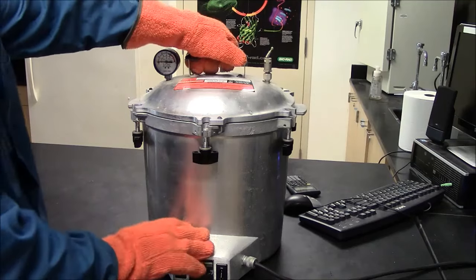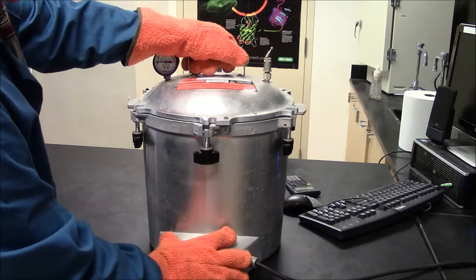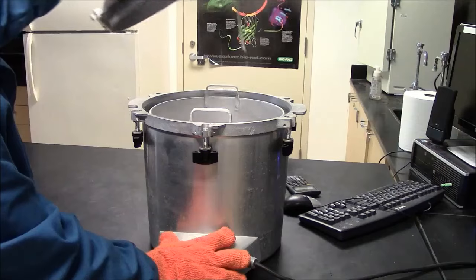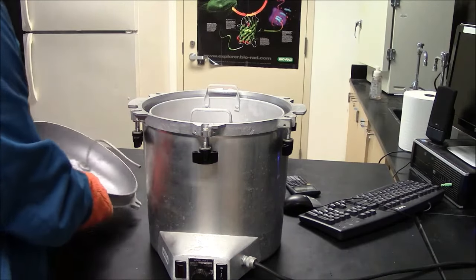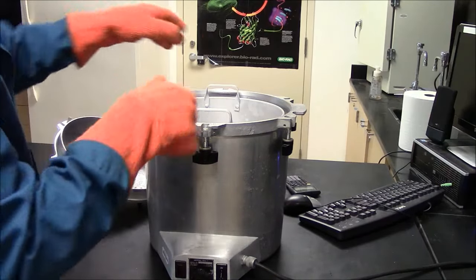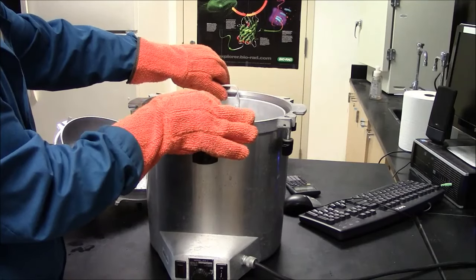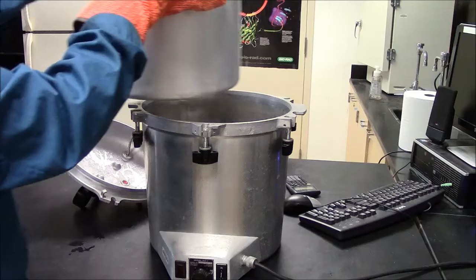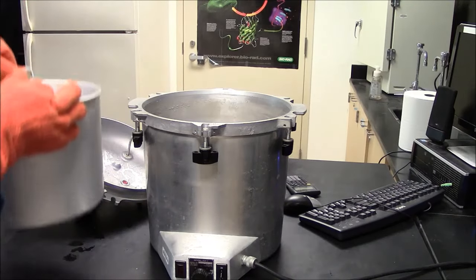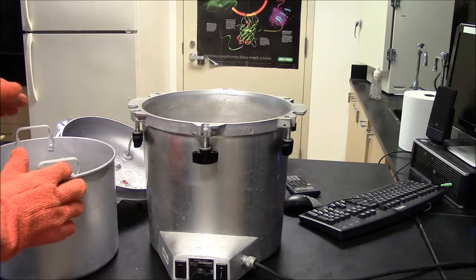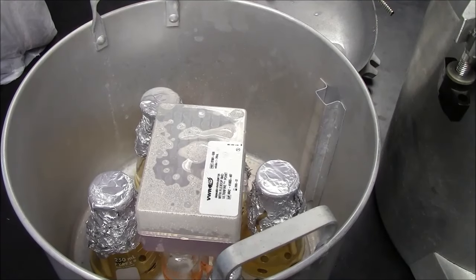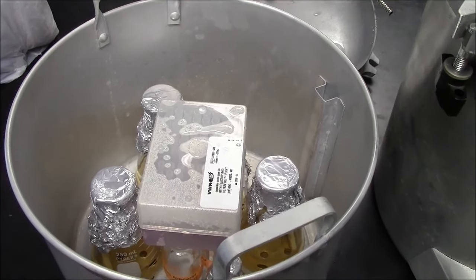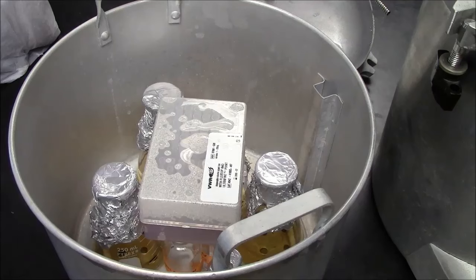And now I can open the lid and retrieve my materials from inside. Careful so I don't spill. So here's my sterilized materials. And they're still hot, so I'll just let them cool down before I take them out.